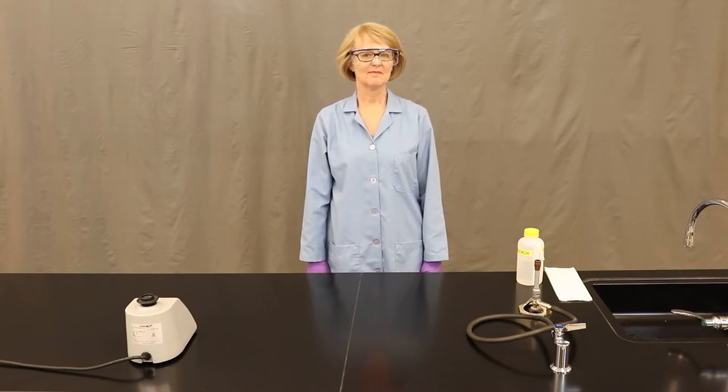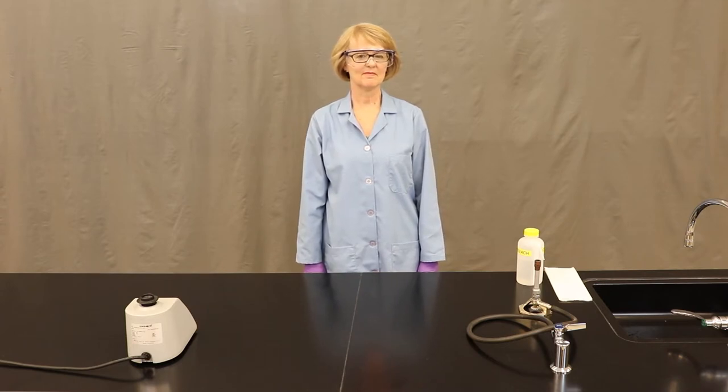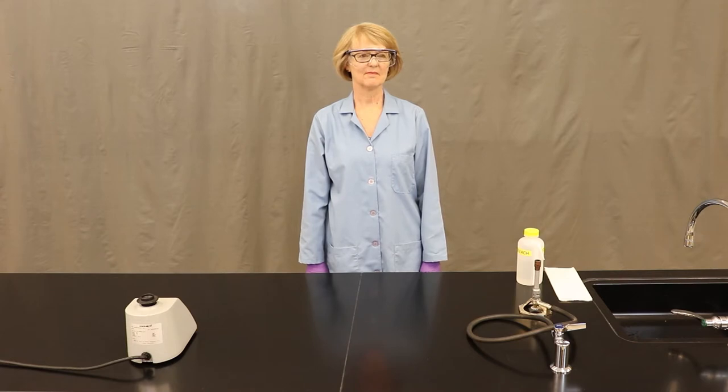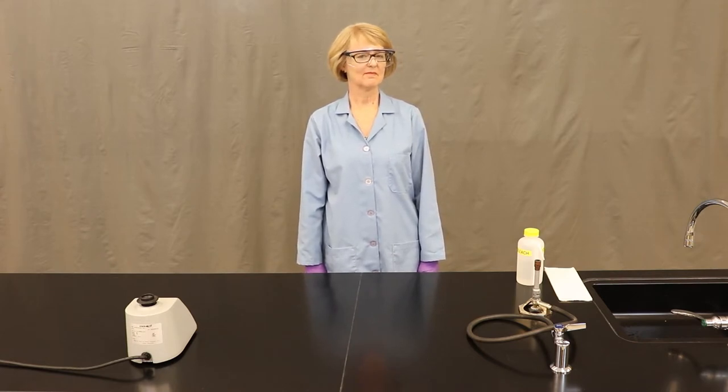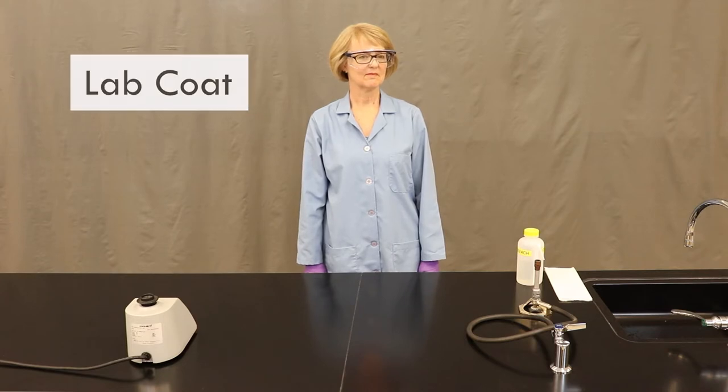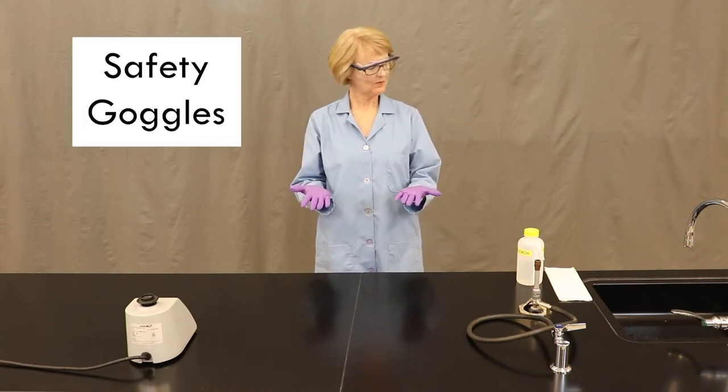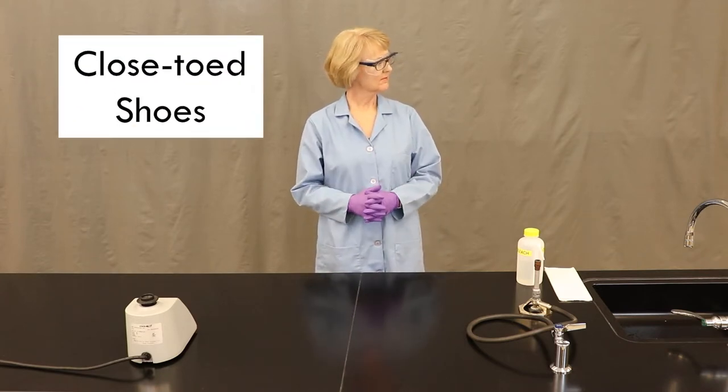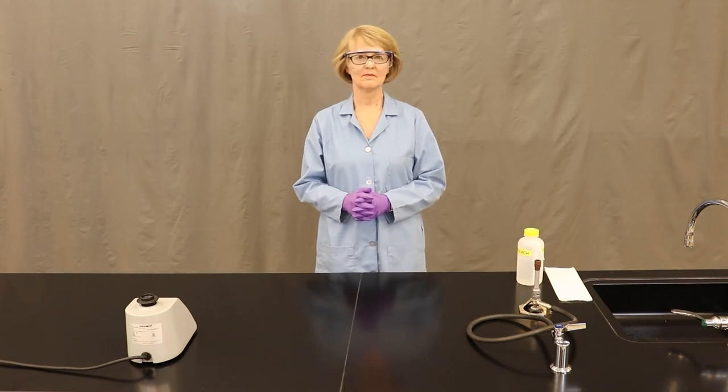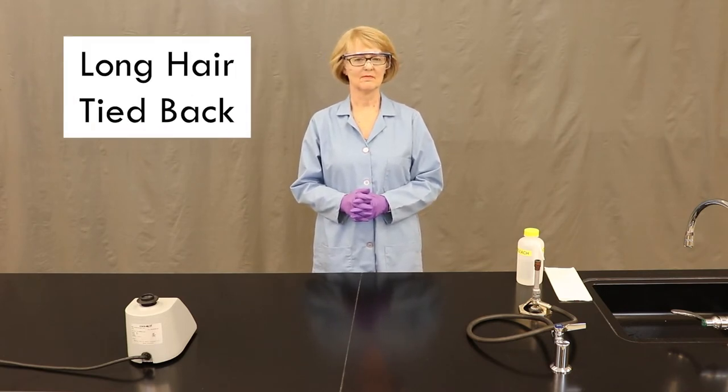Before we get started, the first thing that we're going to do before any experiment in class is make sure that we have the appropriate personal protective equipment on. In our classes here at Pima Community College, we use a lab coat, gloves, safety goggles, closed-toed shoes, and if you have long hair that would be tied back as well before getting started.